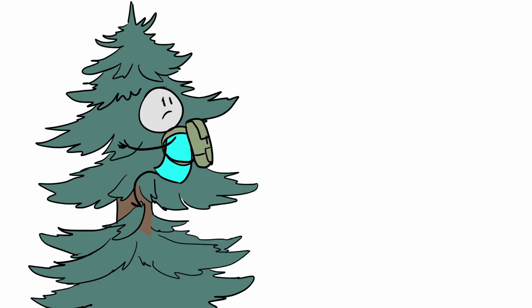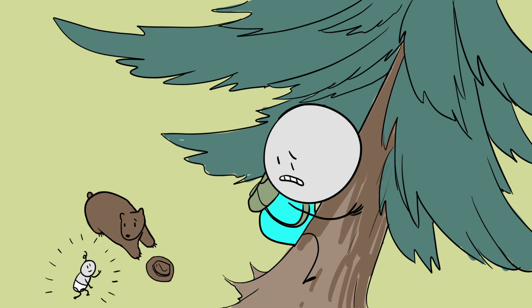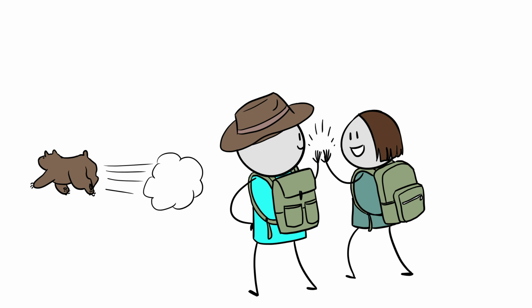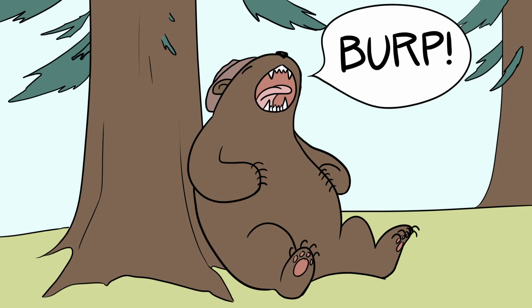If another person is with you, they can assist you in times of danger. No, not just any person. You need someone there who is competent, knows how to use safety equipment, and is willing to help. Then the outcome is an important safety lesson rather than a life-altering tragedy.